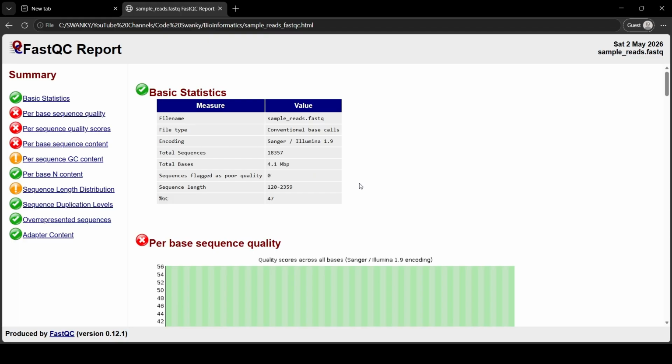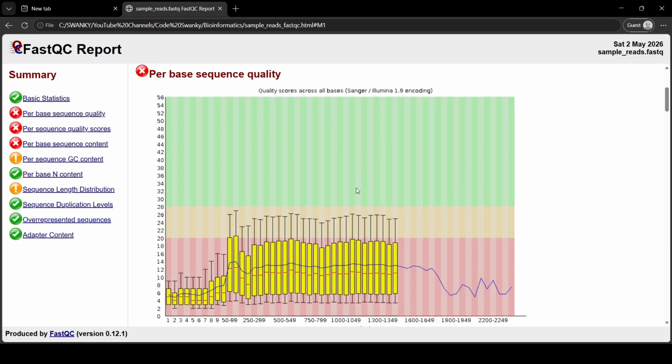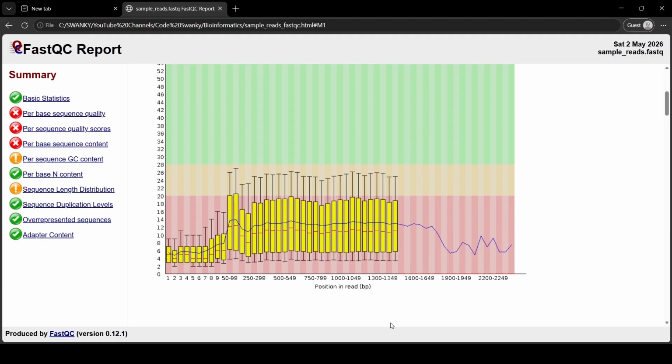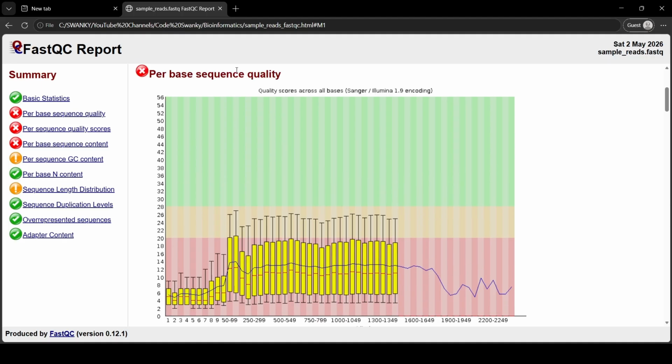Okay, so let's look at basically the most important graph in all of bioinformatics, which is the per base sequence quality plot. Okay, not this one, but this one. Okay, so on the x-axis you have the position in the reads in base pairs from base 1 all the way to the end. And on the y-axis you have our old friend, the Phred quality scores ranging from 0 to somewhere around here.